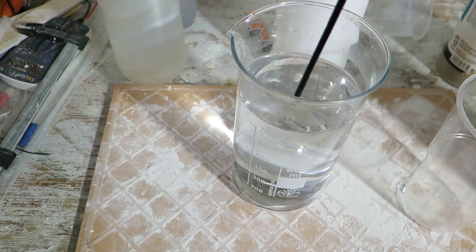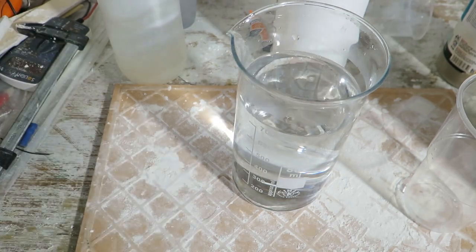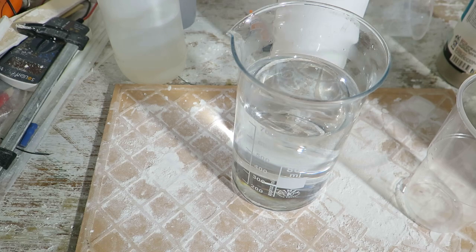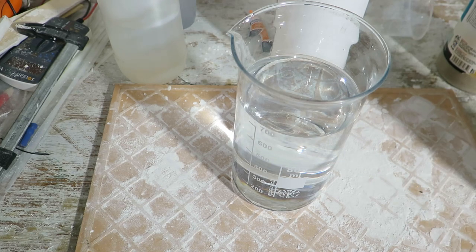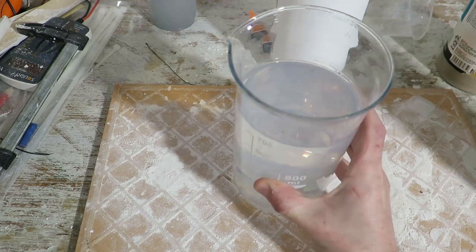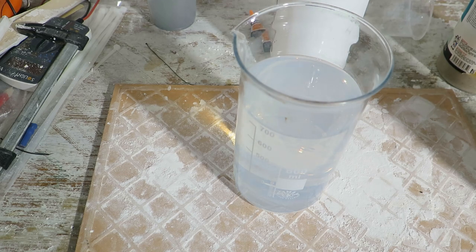But I am not sure if it has any effect of resulting material, I guess not really, but I don't know. Well my point is that I had to wait about an hour for gel to develop, so that was quite unnecessarily long. But I captured the process on camera and sped it up so you can kinda see how it looks.